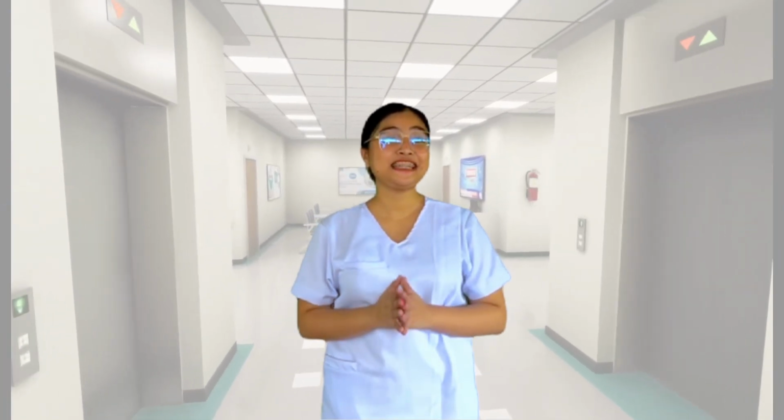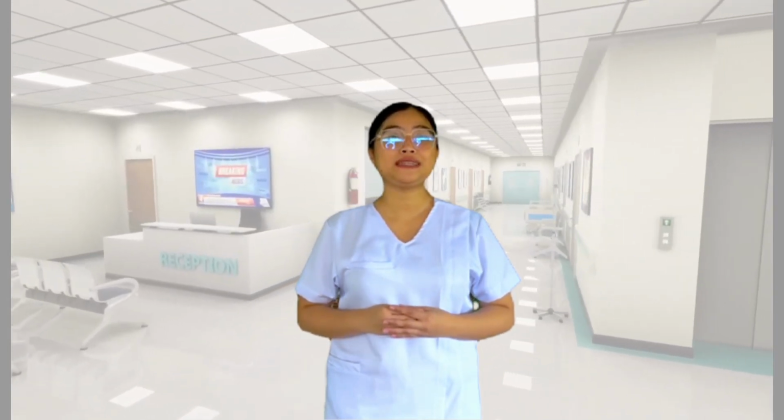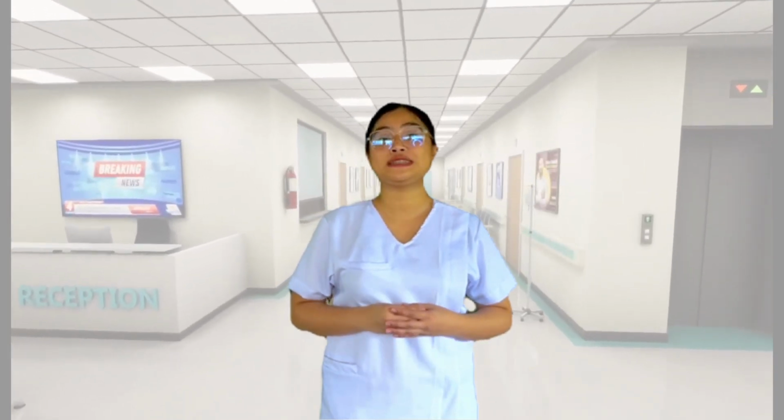Good day everyone, it's Kelly again. In this video, we will guide you through the dissection of a pig kidney to give you some useful information regarding the function and structure of the kidney. My groupmates and I will be going through the external anatomy of the kidney to its internal structure and components, while touching on a few physiological aspects of urine production.